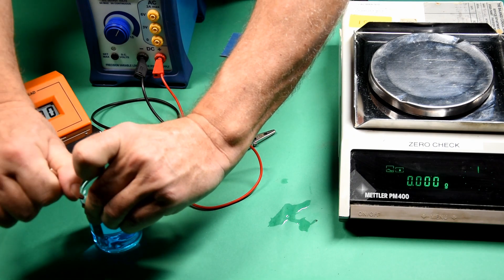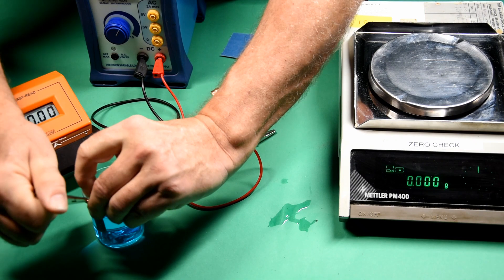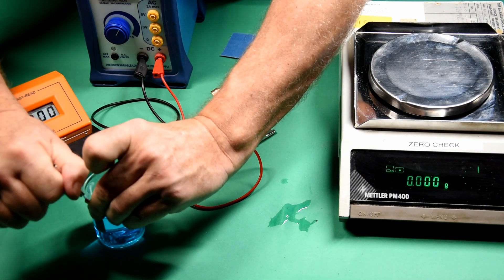The electrode is connected to the circuit using a crocodile clip, though I do seem to make it rather difficult. It was a very tough crocodile clip.